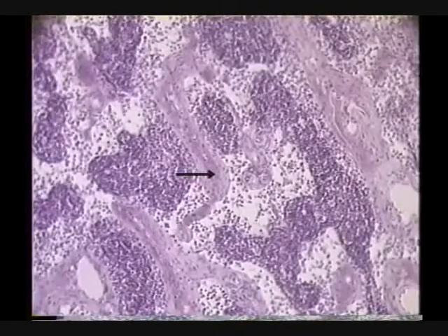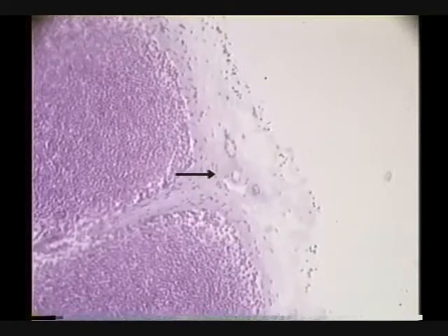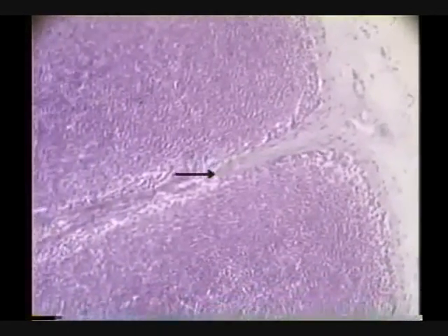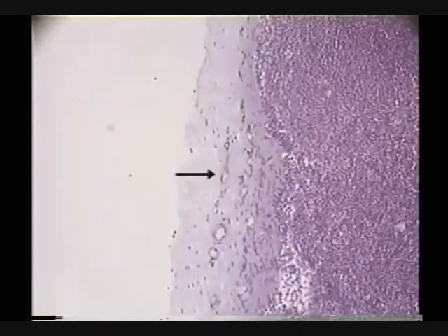We have some connective tissue and blood vessels giving it structure. Let's follow the capsule around - I'm hoping to find a hilum or vessels, afferent or efferent. There's a trabeculum coming in - a band of connective tissue coming in for support. Unfortunately this slide has missed all of that; we just have a nice smooth external surface. I don't see any vessels or a hilum on this particular slide.